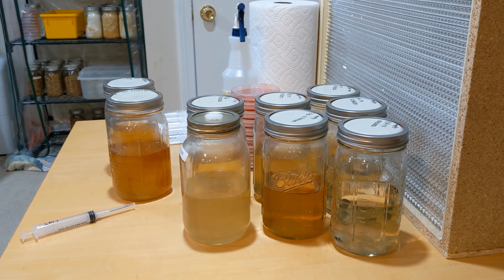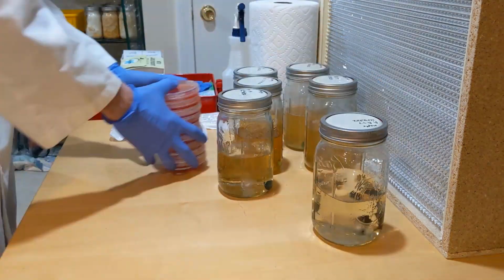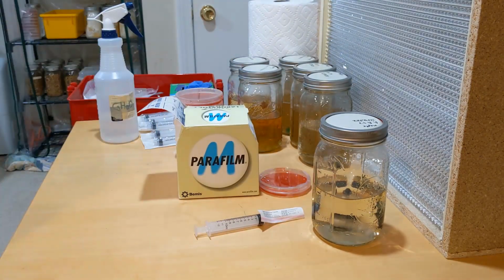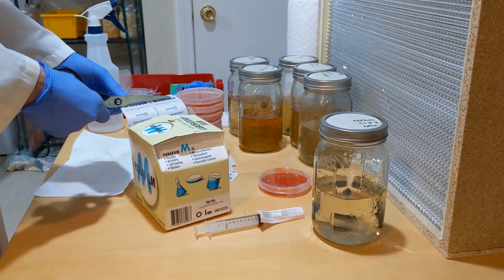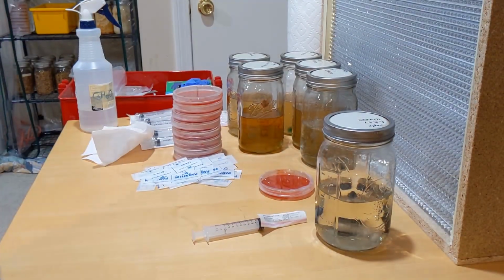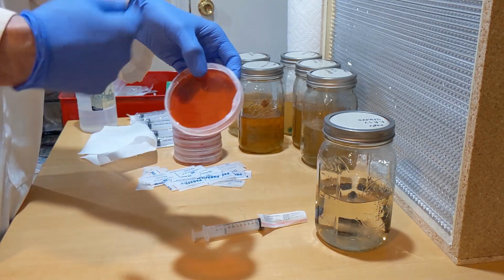Hey, thank you for tuning in. So I'm just gonna tidy up my area a little bit. I also forgot that each of these agar plates needs parafilm to allow for proper oxygen transfer. I couldn't find scissors, so I went upstairs, grabbed some scissors, and then cut the number of parafilm pieces I needed for the plates. Okay, so just tidied up. I cut them in little sections so it's going to be easier to wrap my plates afterwards.